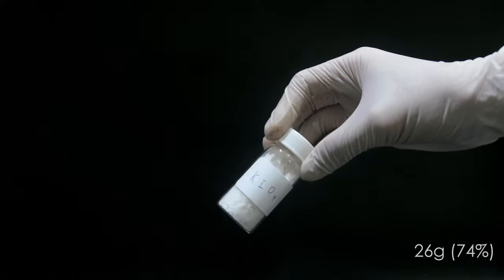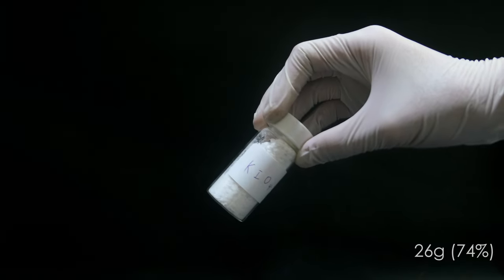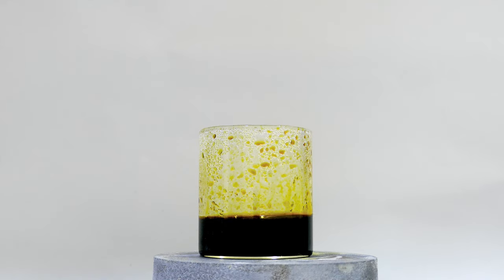The yield is 26 grams, corresponding to 74% based on iodate. Finally, we are going to make our target copper(III) species.